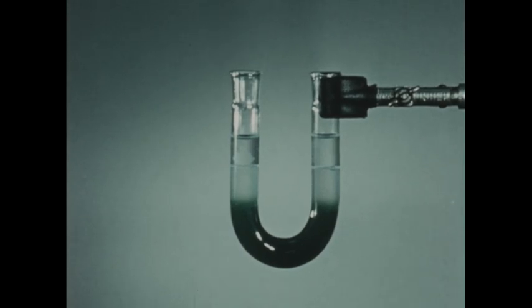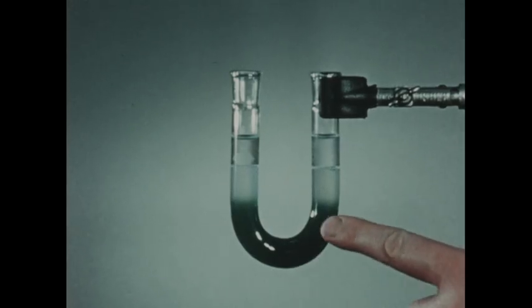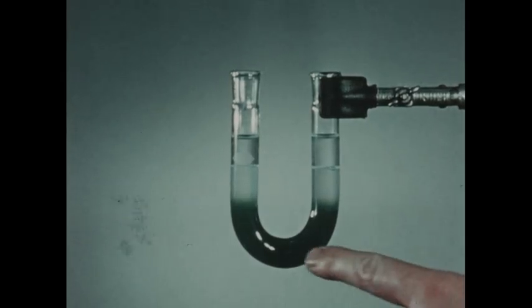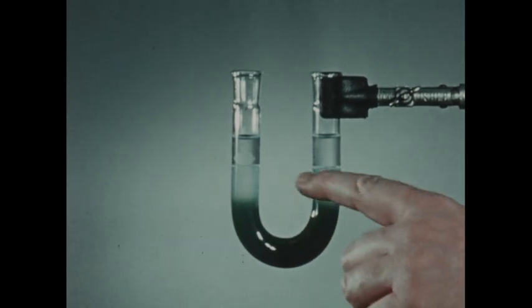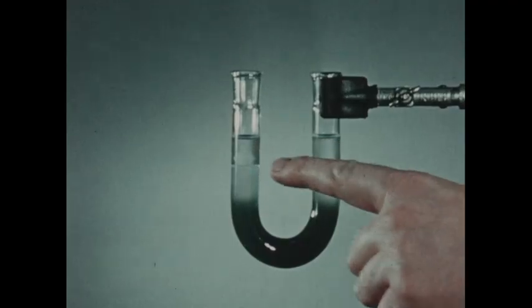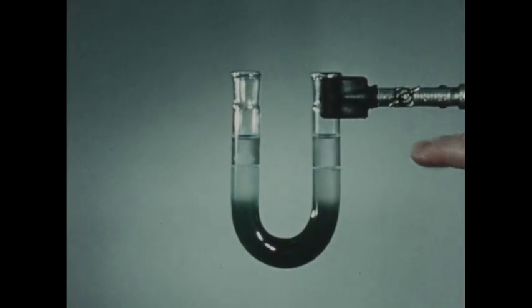The bottom of this U-tube contains a mixture of blue copper ions and yellow or orange dichromate ions, yellow in the concentration we're using, and the mixture appears green. These two ions, solutions of these ions, have been mixed with agar, a material which sets up much like jelly. This is to keep the ions from diffusing too rapidly. Above the agar copper dichromate mixture, we've placed on each side a layer of clear agar. And above the clear agar, a solution of dilute sulfuric acid and a solution of potassium nitrate.